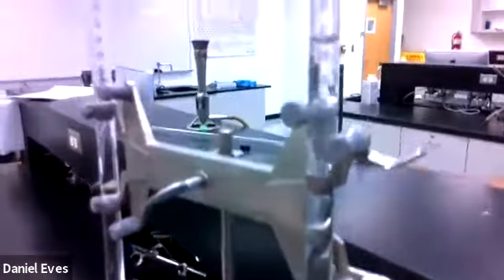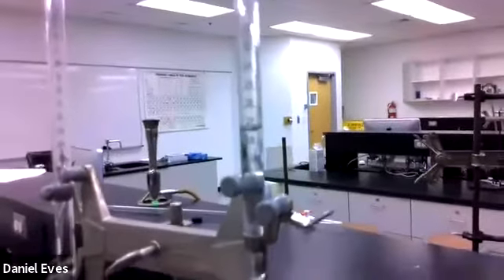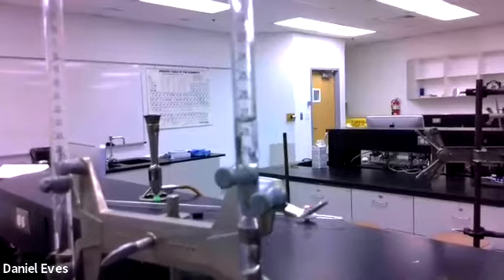And that would tell me that we are reaching the equivalence point. All right, so we're going to go ahead and record what the value is here then of this burette. And we'll get it to a point where maybe you can see it. Let me back it up a little bit where we get the focus.